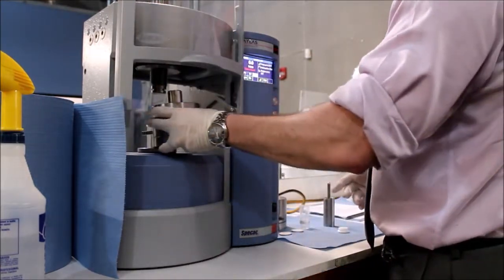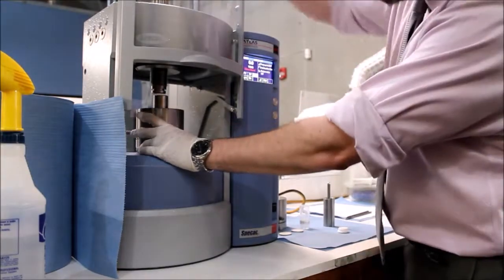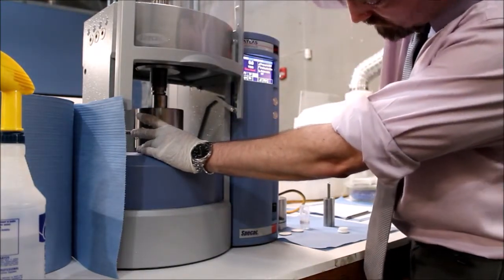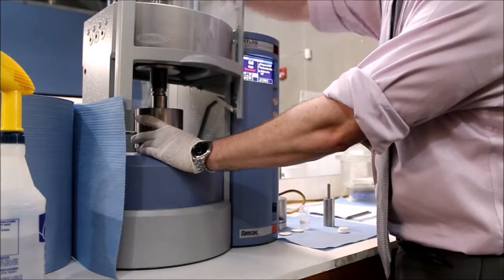Ensure the proper program is loaded and load the die set. Ensure it is secure and the guard is closed.